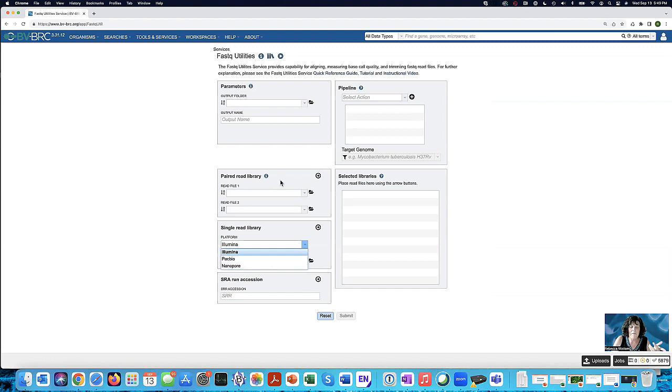Now, why don't they have choices up here? Because all paired reads are Illumina reads. Or if one has data or is interested in data at the Sequence Read Archive, another free resource funded by the US government, you could put in the accession number here. But for this, I'm just going to step you through it pretty quickly. Let's start with the parameters.